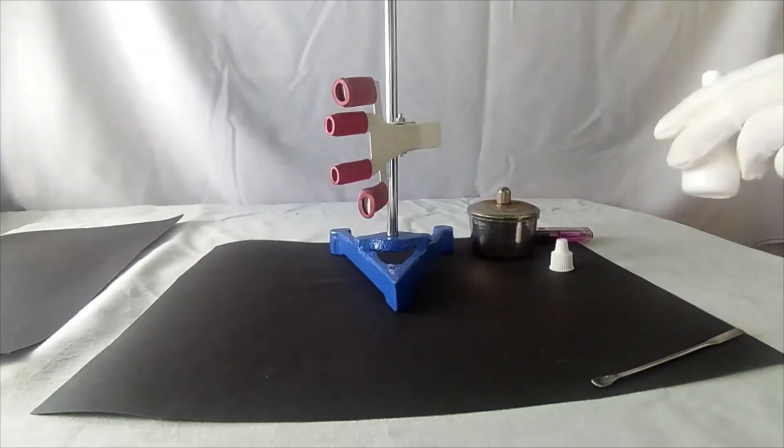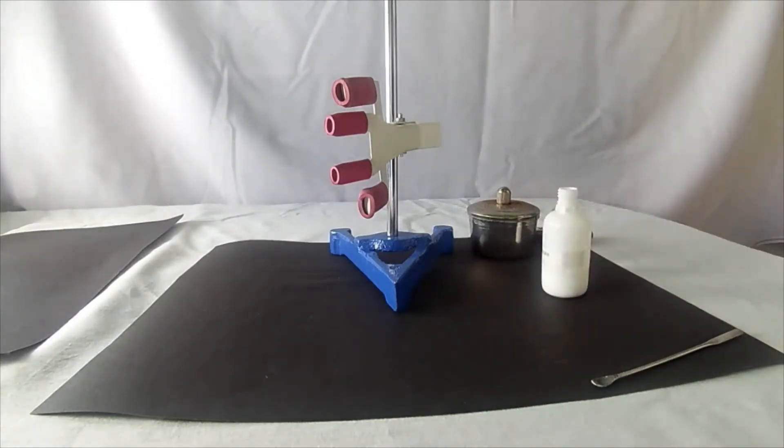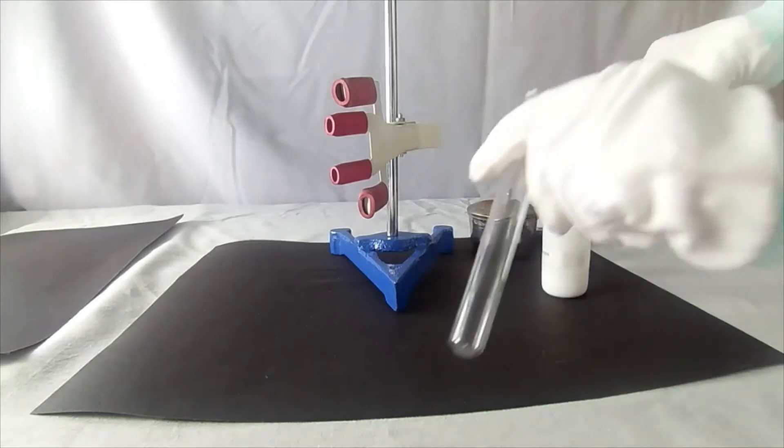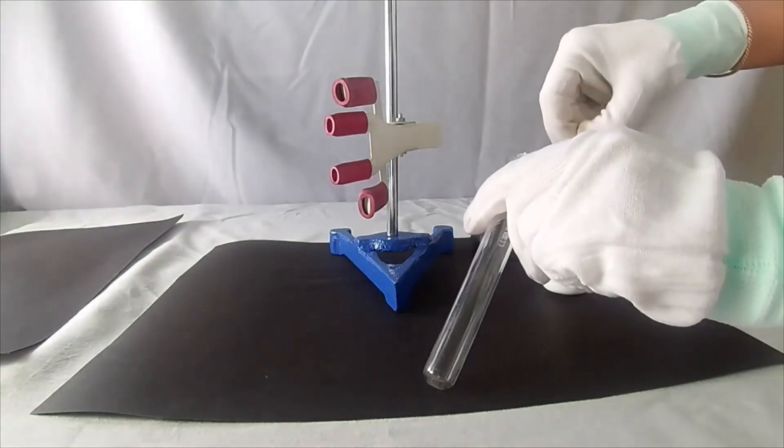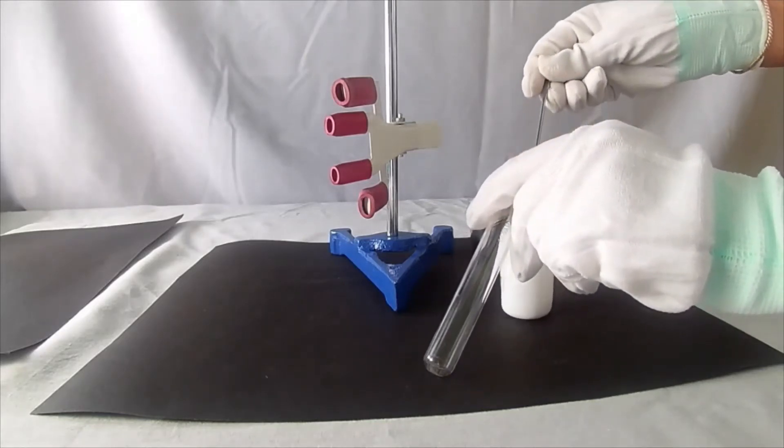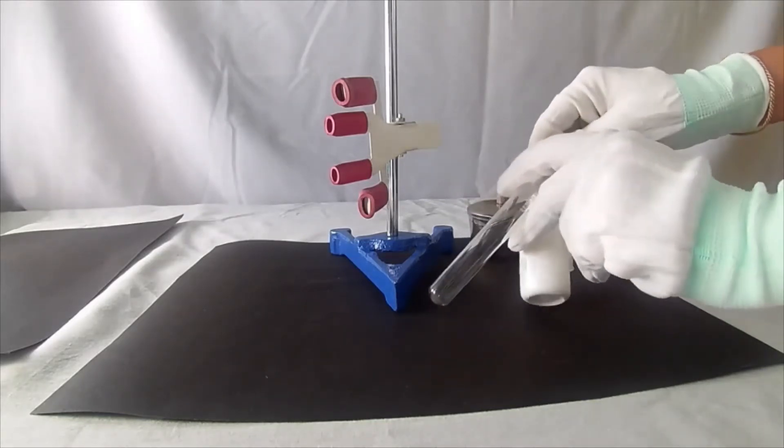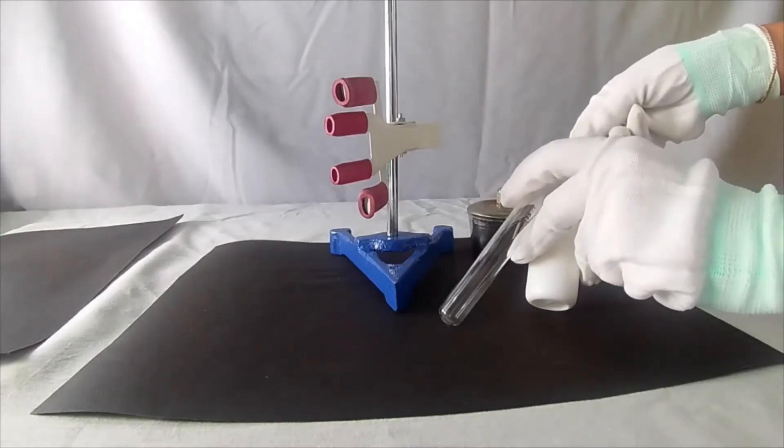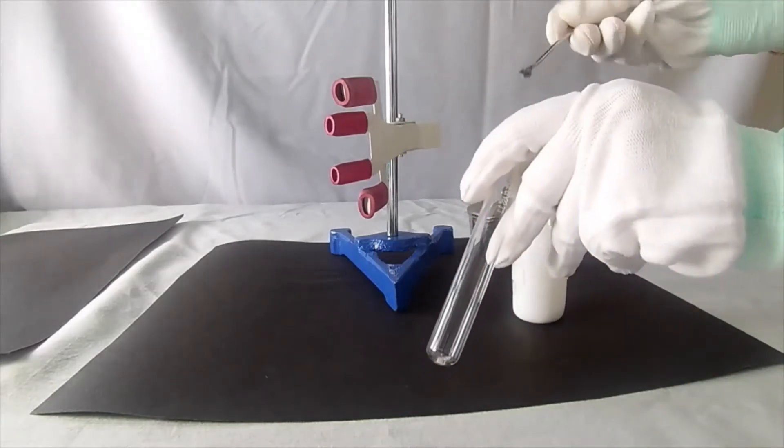Take lead nitrate salt in a test tube. Add salt into the test tube. Do the experiment carefully.